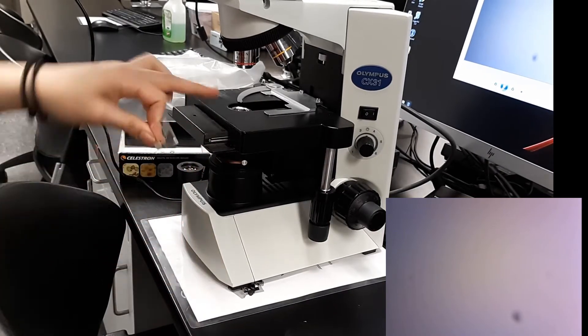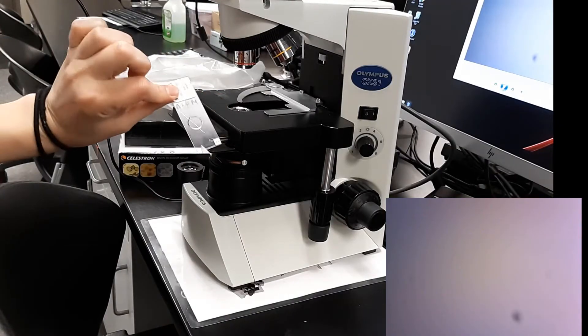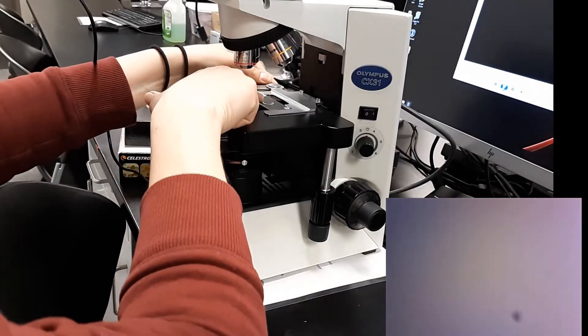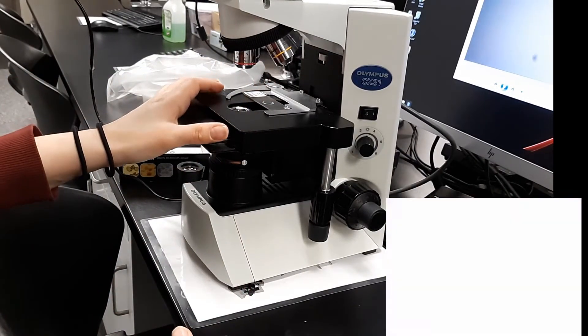Okay, so we can see some light coming through here. This is good. We're going to put our slide on. There's a metal pin. We're going to push this back. We're going to stick the slide up here in the back right corner.